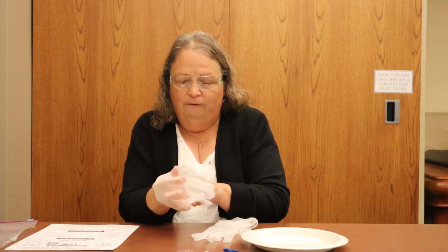Now we're ready to get started with step one. We'll take our safety glasses and put those on, and then we'll take our gloves and put those on as well. If you have to wiggle around to get those on correctly, that's okay. If they don't feel right, you can always switch them around and try that and see if it feels any better. Once we've got those in place, we'll be ready to move on to step two.